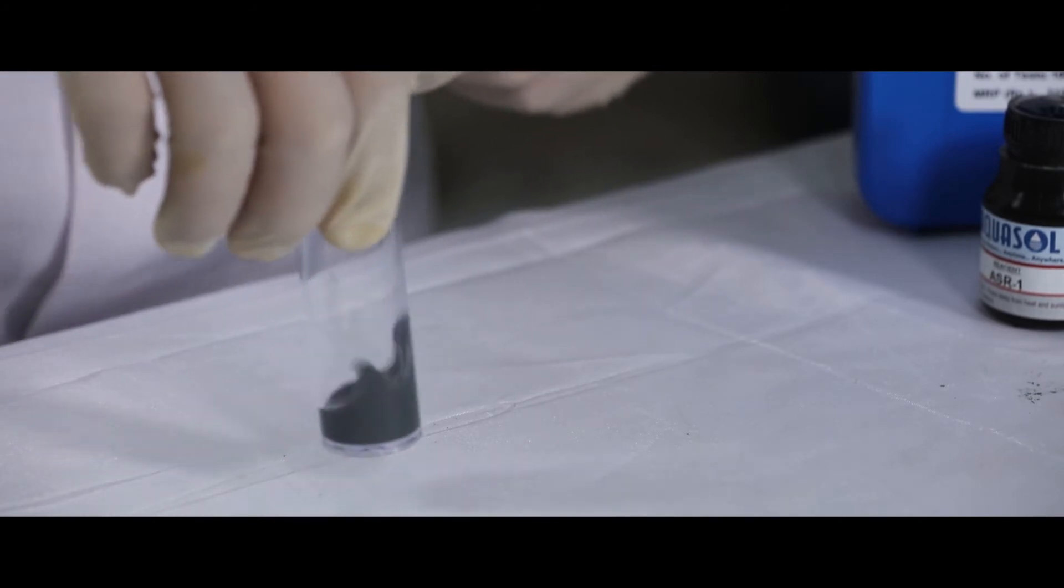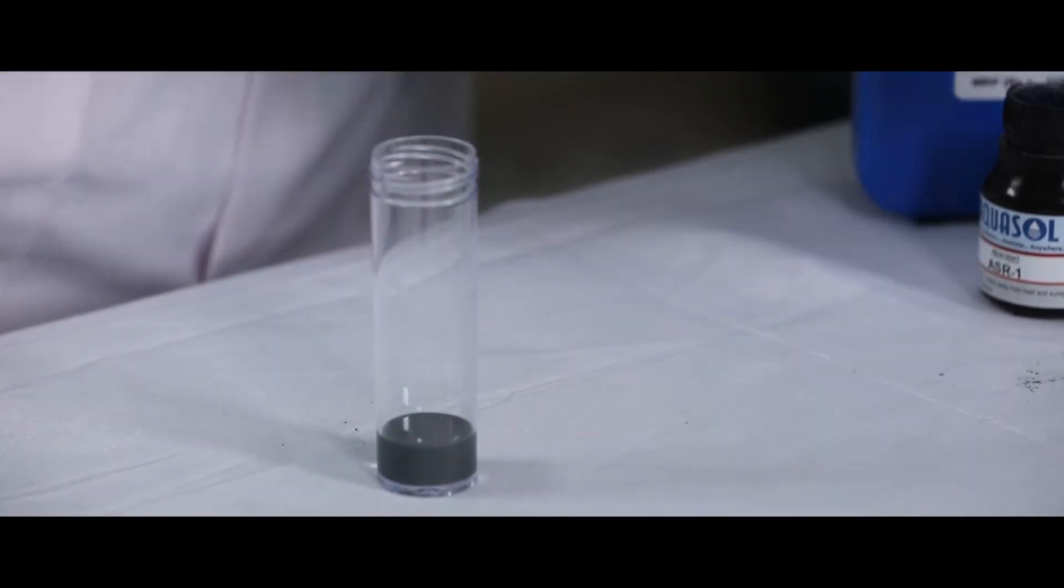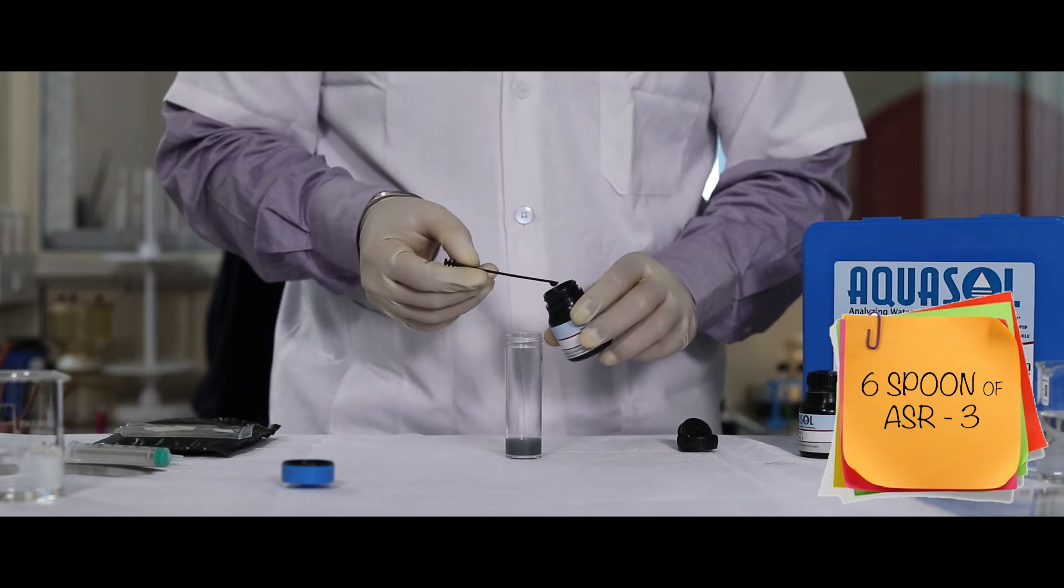Swirl the contents for a minute. Once mixed well, add six spoonfuls of ASR 3.